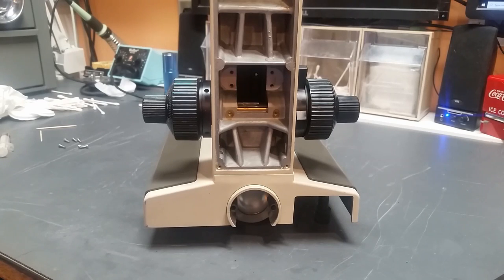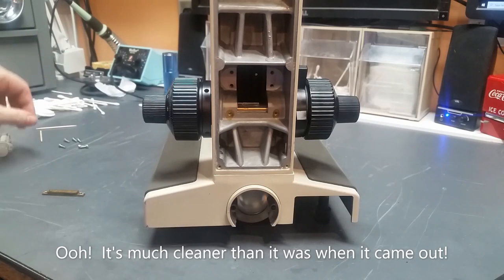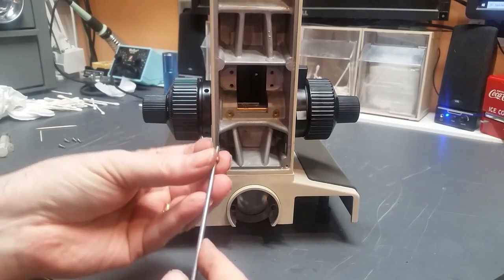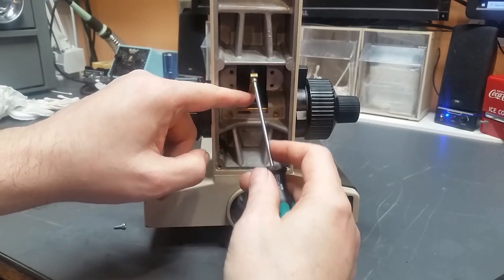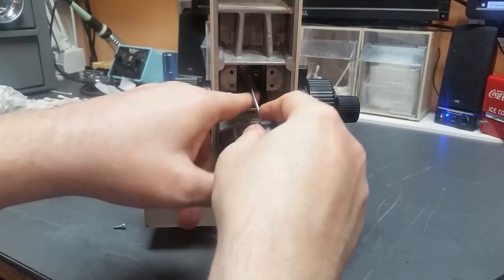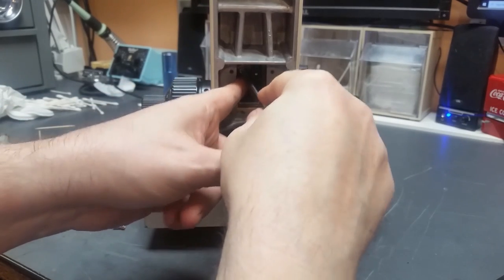Okay, before we put the gearbox in, what we need to do is take the brass rack here. We need to put that in. It's held in with these two screws. I take a 2.5 millimeter hex tool, put it through there, carefully drop this in position.